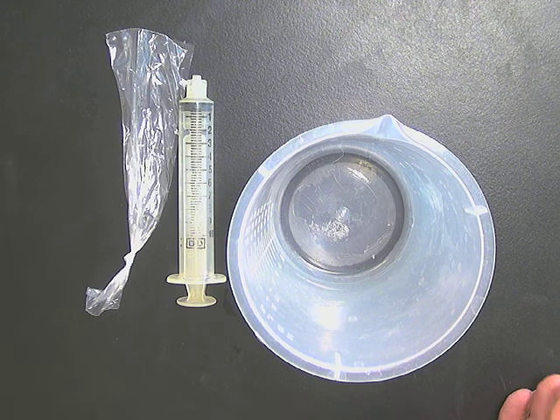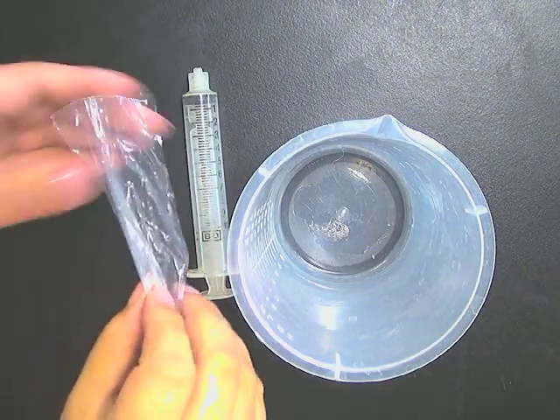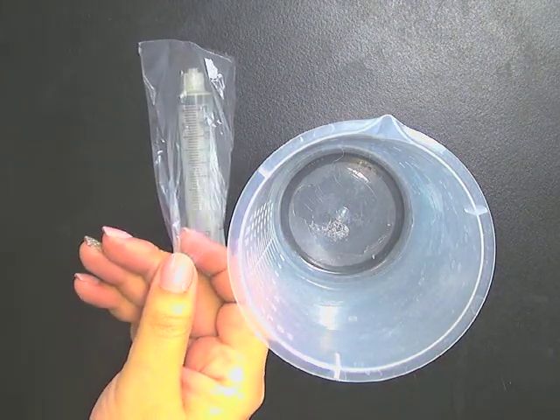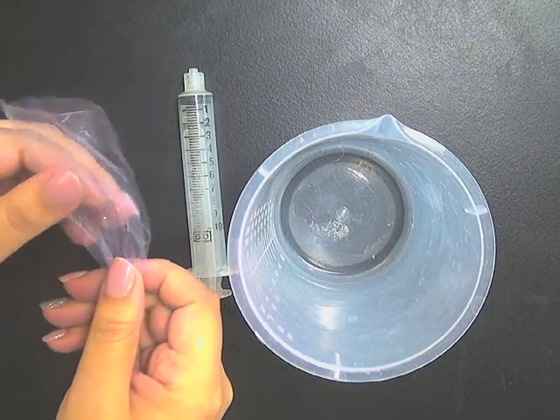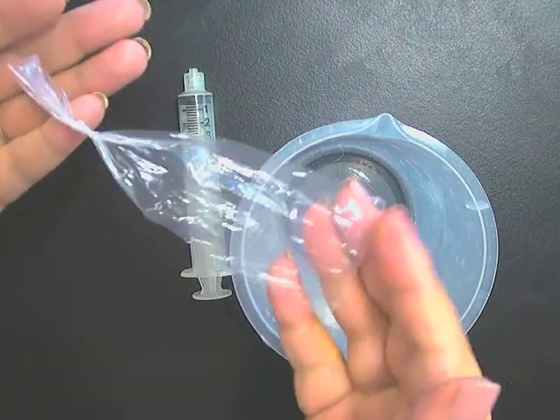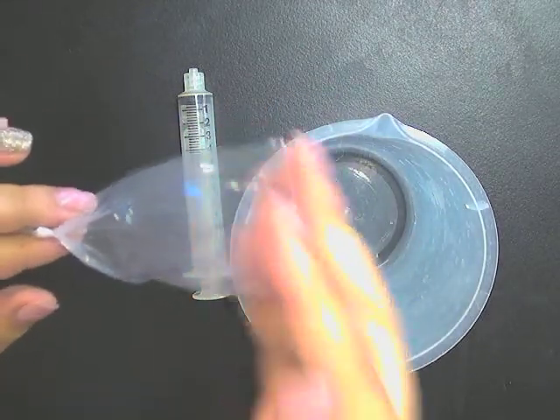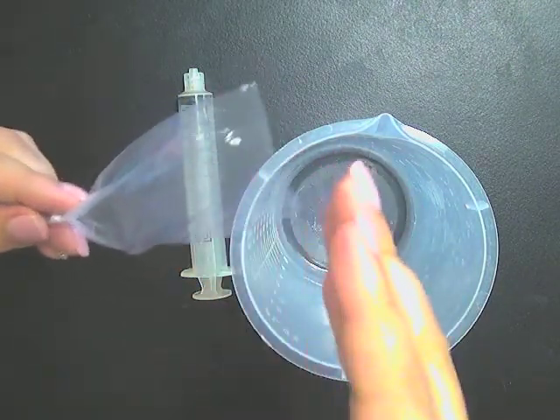In this investigation, we are looking at what the percent change in mass of dialysis tubing, which is a tube like this, is in response to the process of osmosis. So what you are going to be doing is taking these dialysis bags and filling them with an unknown solution. The solutions will be different colors, and you're going to try to figure out what the different molarities are for the different colors.